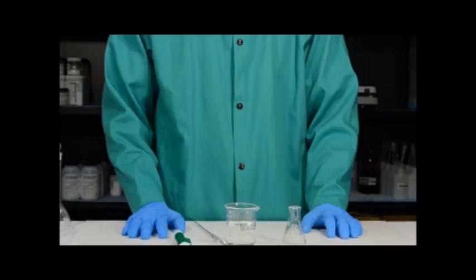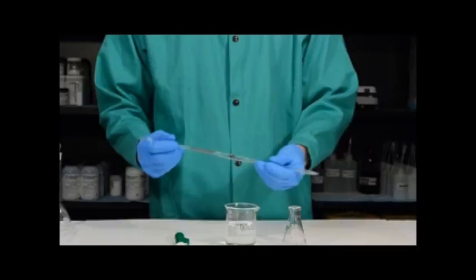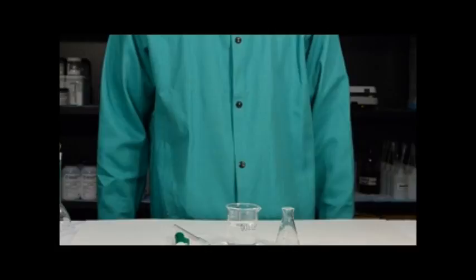In this experiment you will determine the volume of water transferred using the volumetric pipette by mass. Over several trials you will transfer five milliliters of water from the beaker into an Erlenmeyer flask and record the mass. Knowing the mass of the empty flask and the mass after each subsequent trial, you will subtract and find the mass of water for each trial.